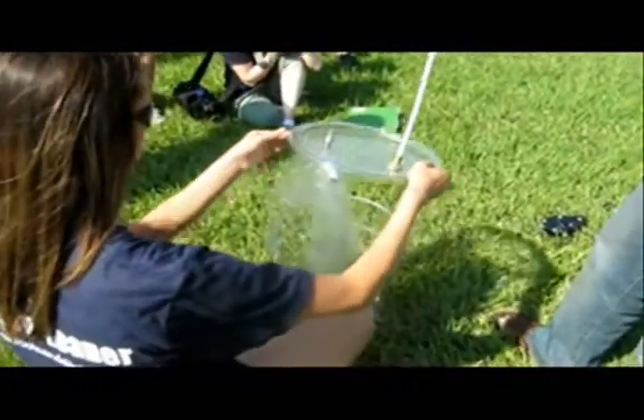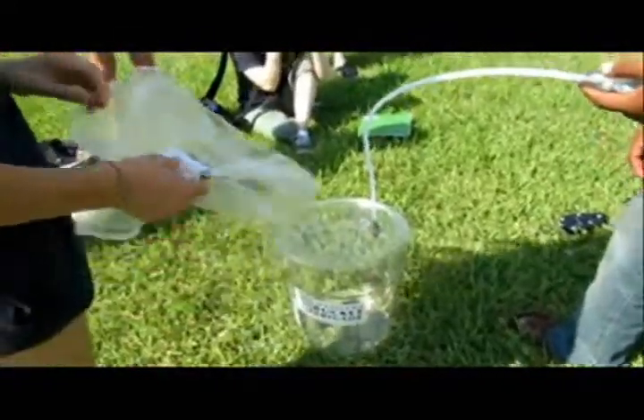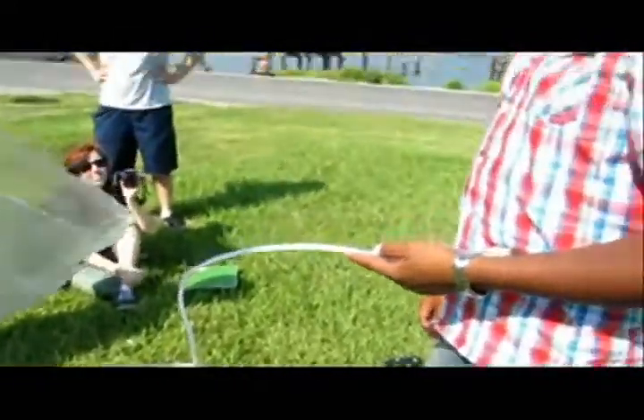There's still one thing open, so we're going to close that. And that's how we get the sample — it's super simple and super cheap.